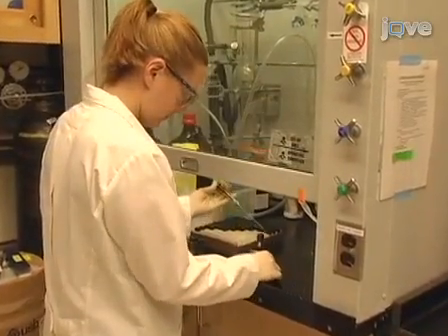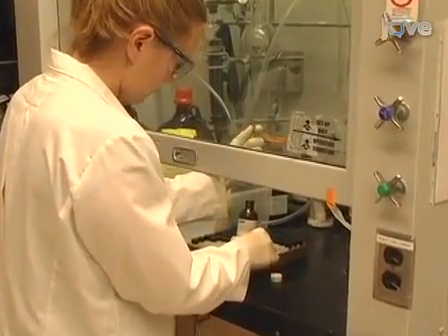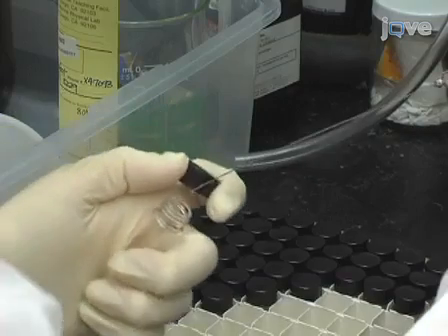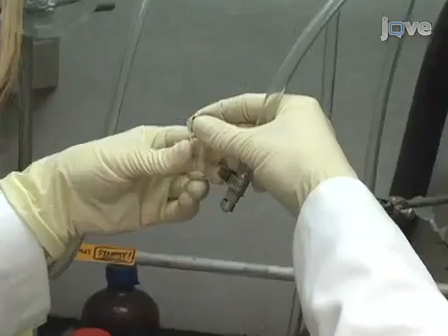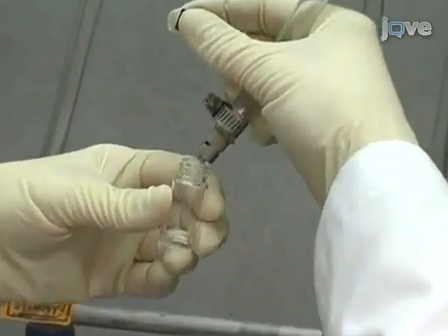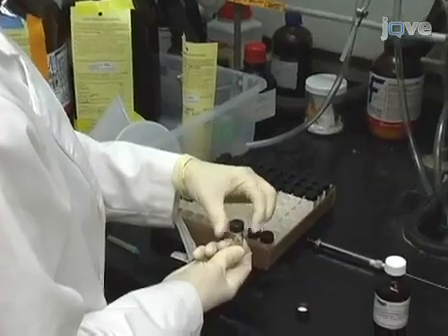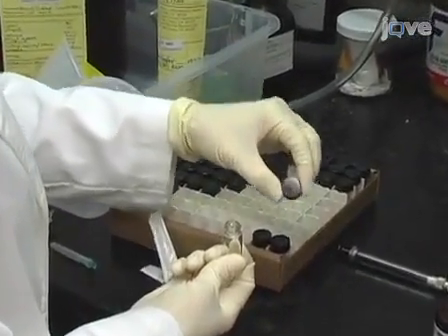Prior to the start of this protocol, purchase a solution of 1,2-dimyristoyl-sn-glycero-3-phosphocholine, or DMPC lipid, in chloroform and aliquot into clean glass vials at 20 mg per vial quantities. Add a layer of nitrogen gas to each vial to prevent lipid oxidation, and seal the vials. A single vial containing 20 mg of lipid in chloroform is used for each experiment.